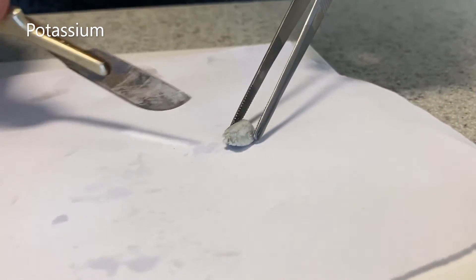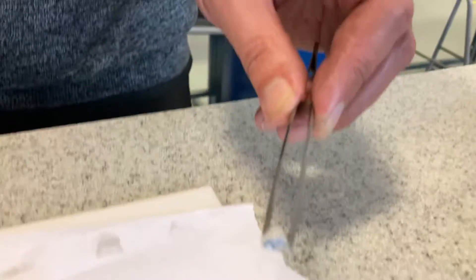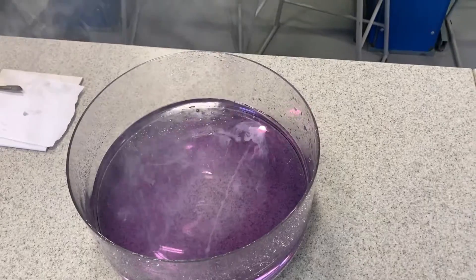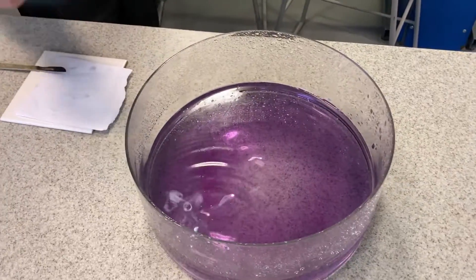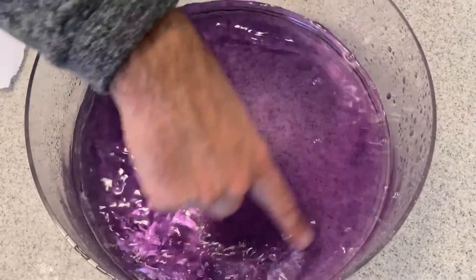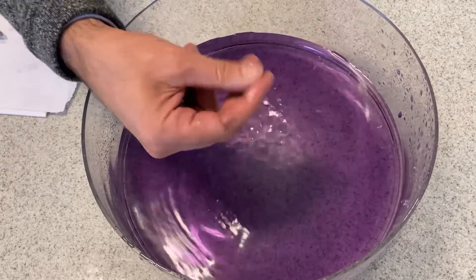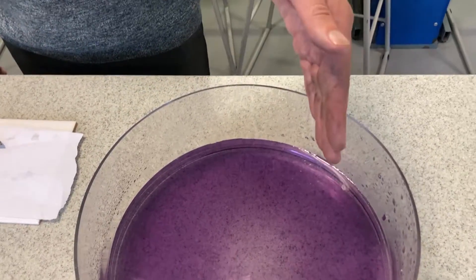Soaking the oil off it. It doesn't look like a metal but again, very easy to cut — it's like there's nothing there, really. You can see inside — lovely and shiny. I'm going to drop this in, and camera back a bit because it's not very nice. It just goes straight on fire by itself, instantly. Let's try the other half — straight away, catches fire; we can see it's melted. See all this liquid here? This is all purple because we've made lots of hydroxides — potassium hydroxide, sodium and lithium. It feels soapy, because all alkalis feel soapy. We've made lots of hydrogen and it burns. The potassium is the most reactive; lithium is the least reactive, but they're all pretty reactive.